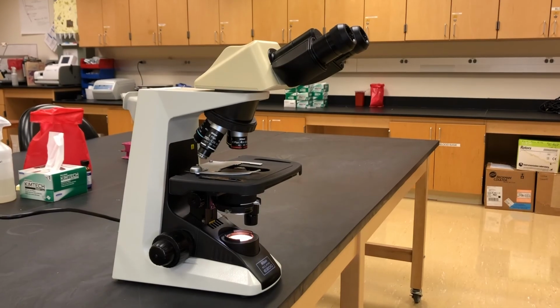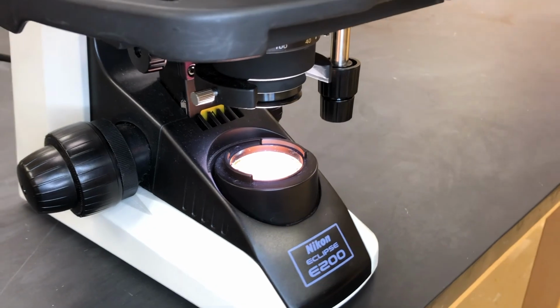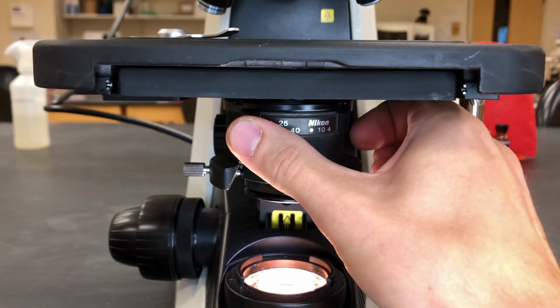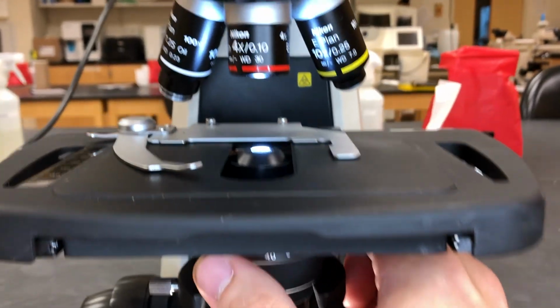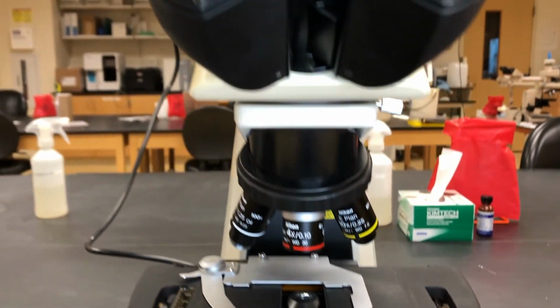This is a bright field microscope. This is what we're going to be using. We look at the bottom again where our light source is shining through. Above that you can see that we have our condenser lens. On the condenser lens we have our diaphragm. Diaphragm can control the light going through. Typically on a lower objective we'll have it on the right. That will allow less light to come through. And on the left we'll have it for a higher objective, and that will allow more light to come through.